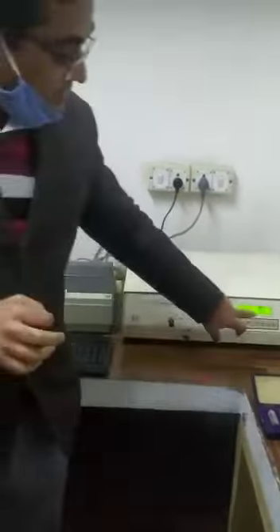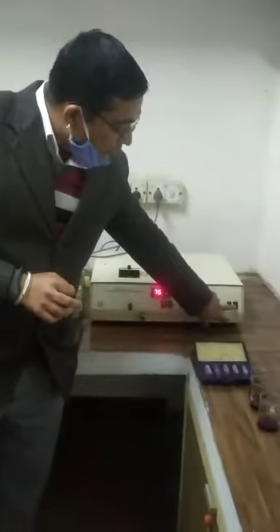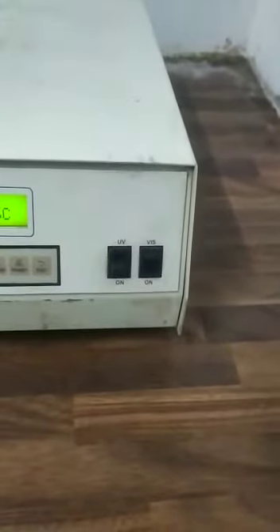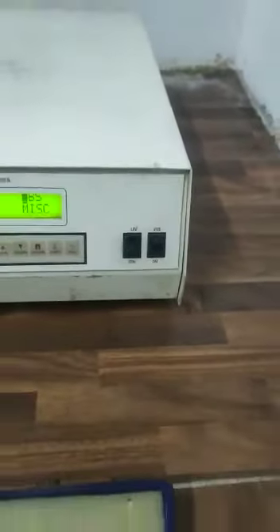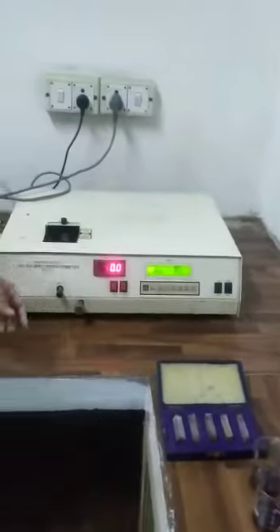Now look at this one. We have the visible lamp on, not the UV lamp. If you want the UV lamp, it will make a load over that one. These are the tubes.